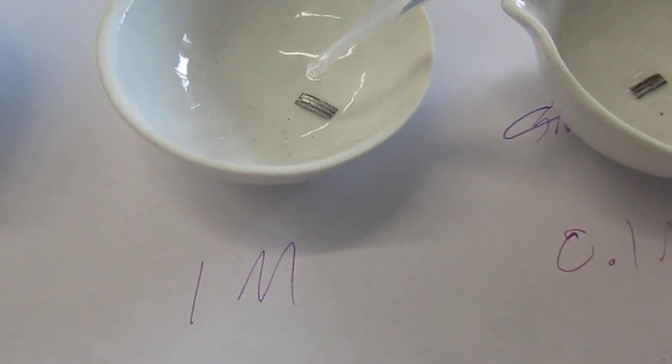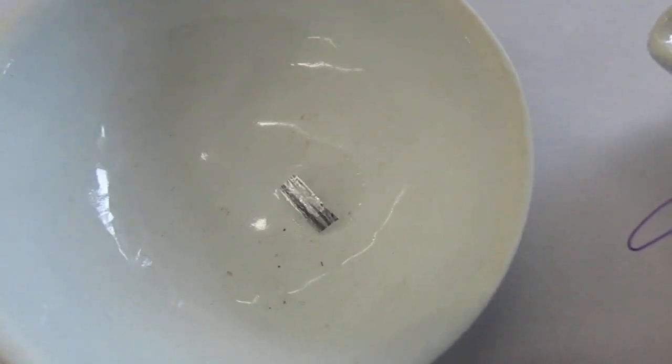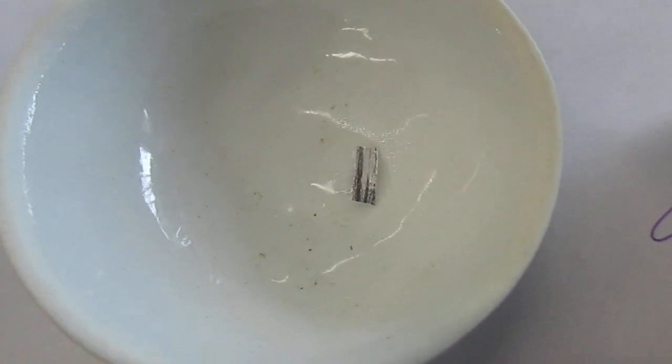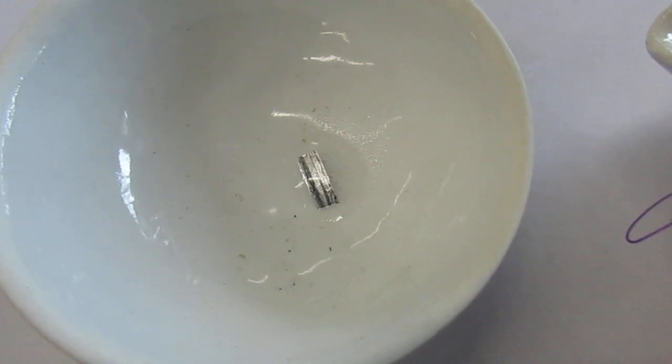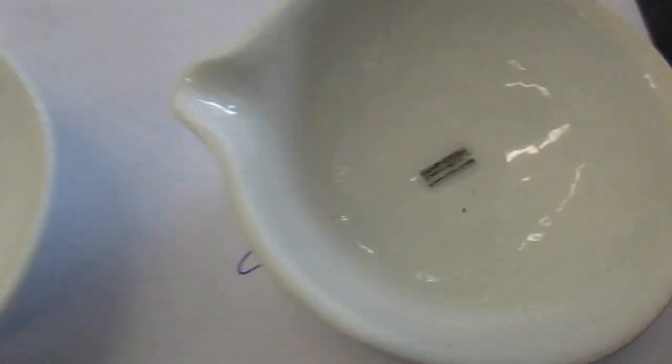I'm just doing one drop right on top of it for comparison.